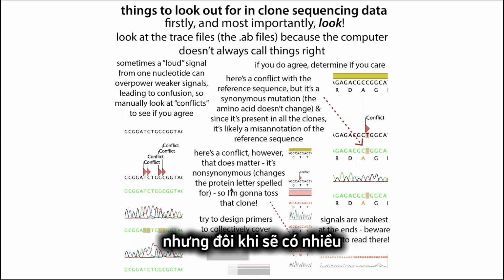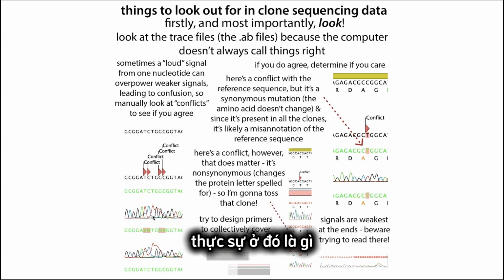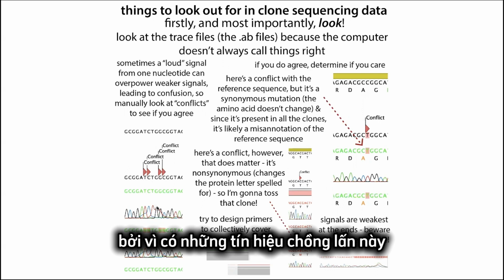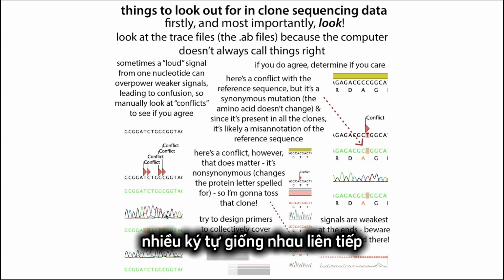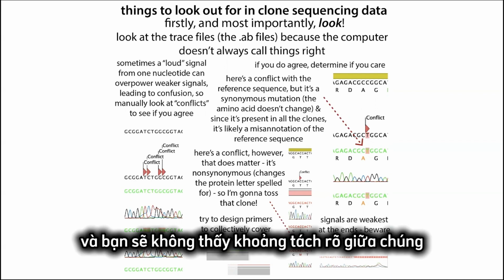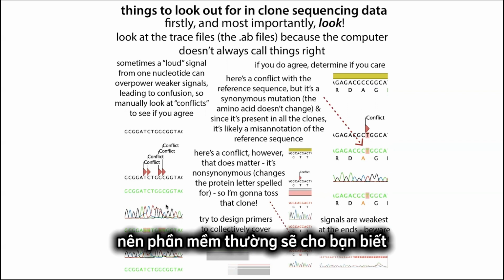But sometimes there's going to be multiple traces, and the software isn't going to be able to figure out what is actually there. And so you'll see something like an N or an X, which is basically saying that the software can't make the call because you have these overlapping traces. You can also get problems if there's multiple of a letter in a row, where it can blend together. So if you had multiple A's or multiple G's or multiple C's, you can get traces that overlap, where you don't see the big dip in between them. And this can make it hard for the software to make the right call.